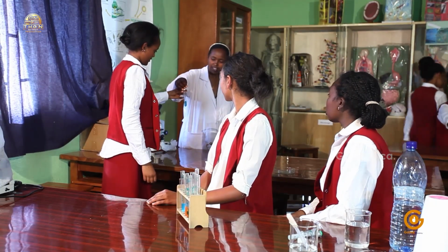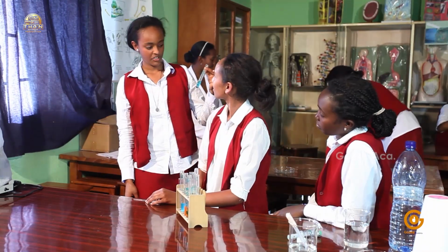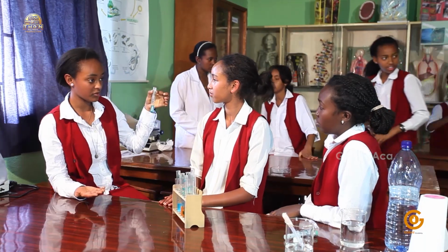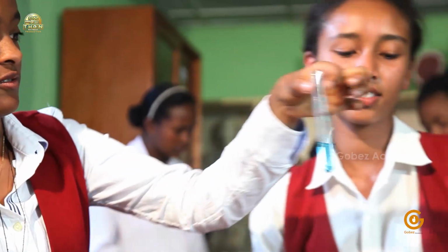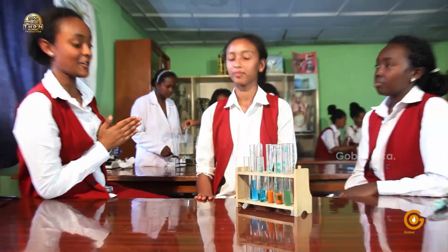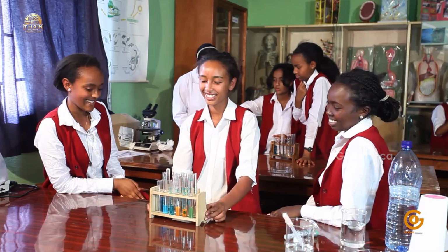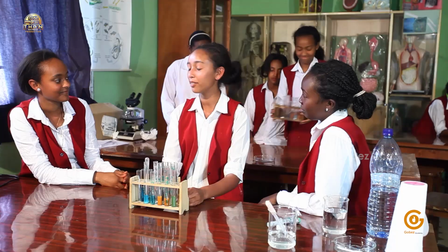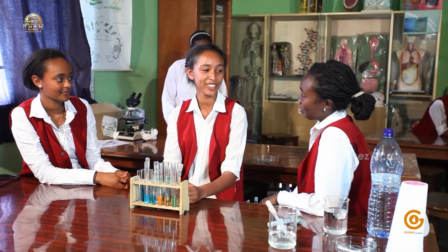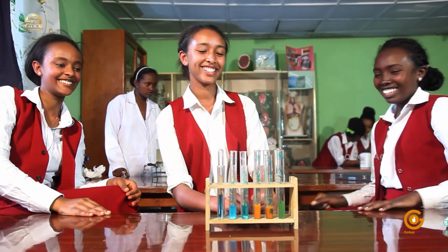Thank you, Miss. So as you can see, the water in the control is still blue. There is no color change. Oh yes. That's right. So I think we have had a successful Benedict's test. We have indeed. Yes. But we mustn't forget that monosaccharides, like glucose and fructose, dissolve faster in water than cane sugar. They are also sweeter than cane sugar. Yeah, you're right. Yes.